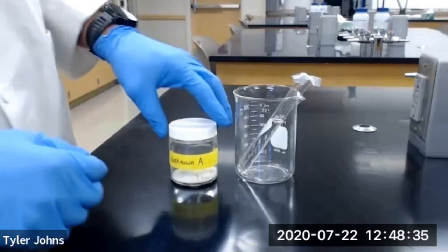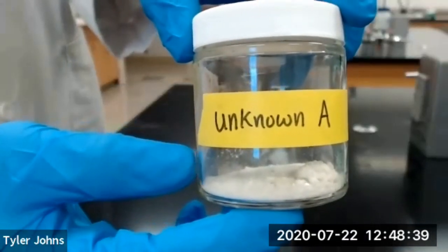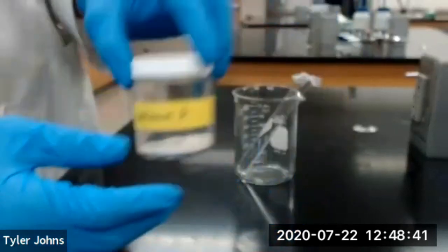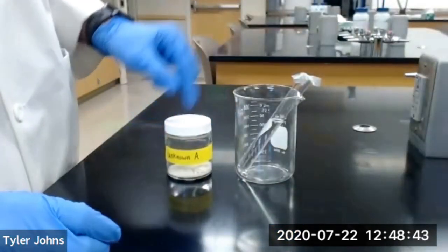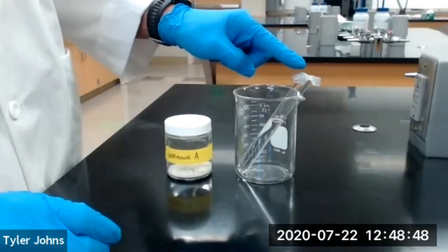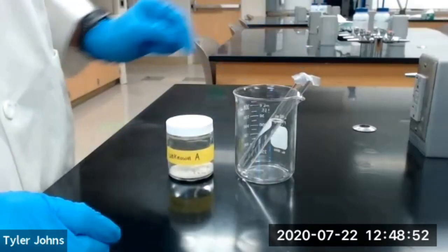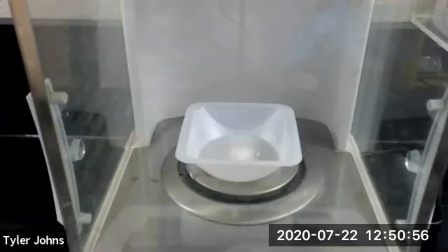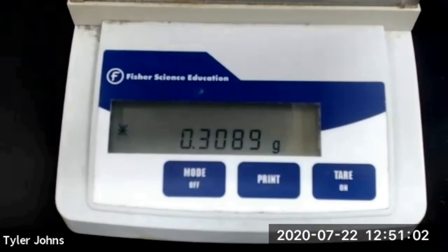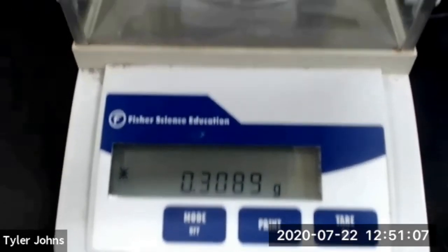We next need to measure out approximately 0.3 grams of our unknown solute. We'll be using unknown A, and we'll transfer our unknown solute to our test tube containing our cyclohexane. And we need to be sure that our solute is completely dissolved in our cyclohexane before proceeding. The mass of unknown A that we will be dissolving in our cyclohexane is 0.3089 grams.